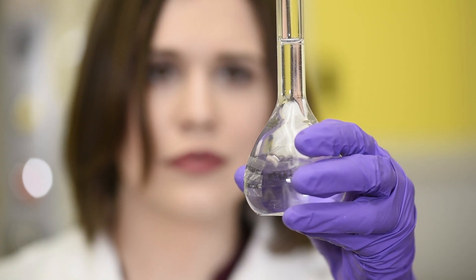This volumetric flask, however, measures 25 milliliters plus or minus 0.03 milliliters, so it's more precise. When measuring a volume, ensure that the bottom of the meniscus is touching the line marked on the glassware. The meniscus is the curved surface of the solvent shown here. Bring the line on the glassware level with your eye to properly read it.